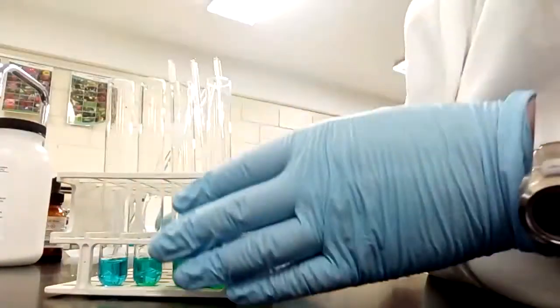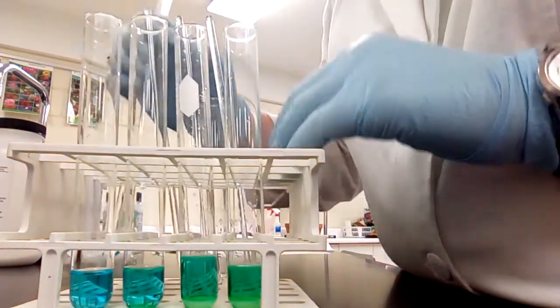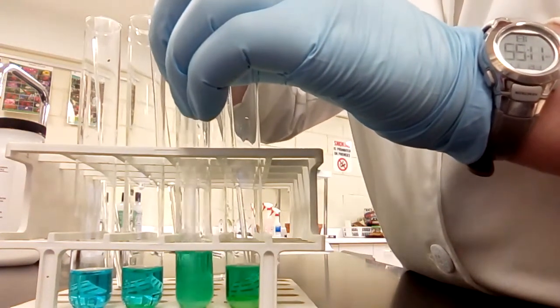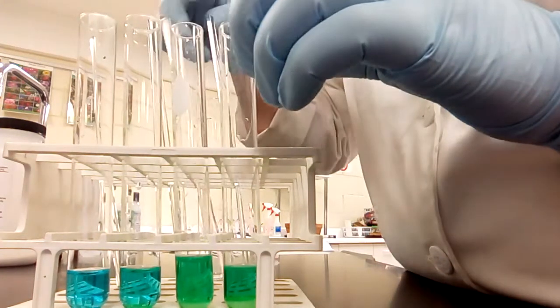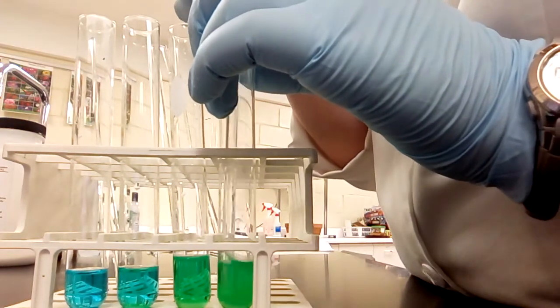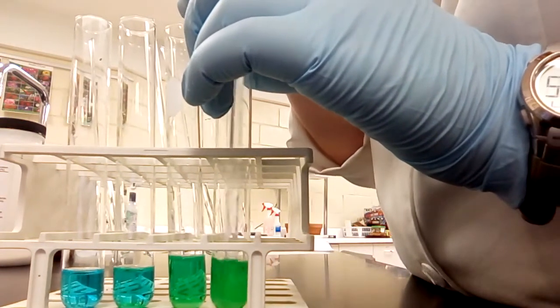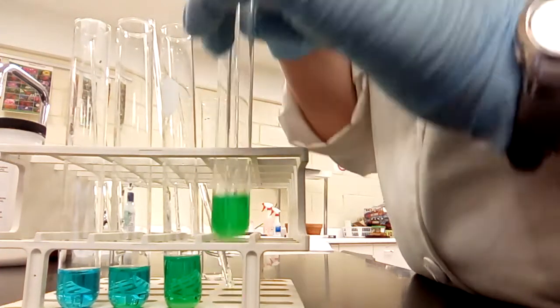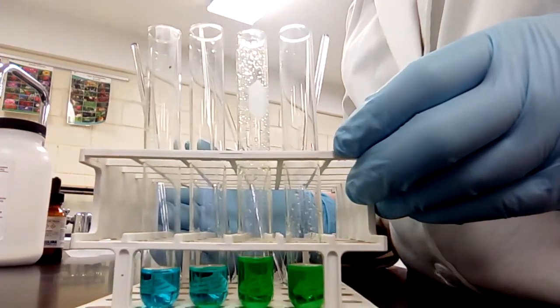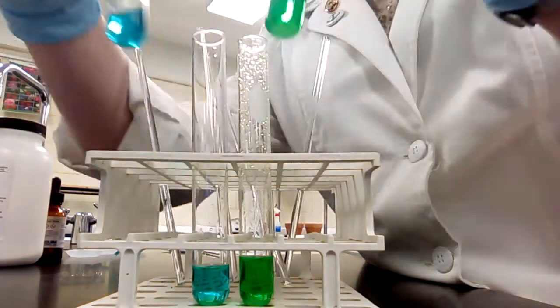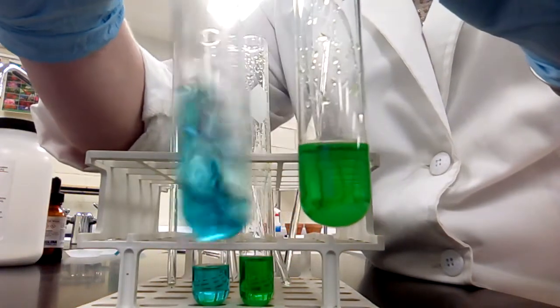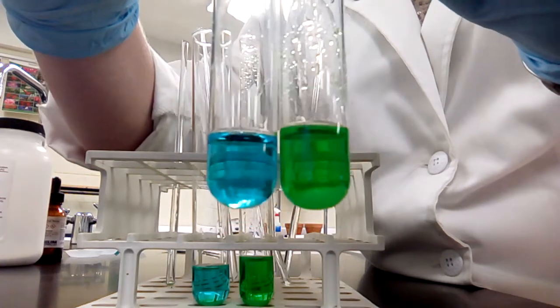All right, there's some other things we can have fun with this. So that's your basic reaction. These need to be a little bit better dissolved. The salt doesn't want to dissolve in there for me. Because, you know, sodium chloride is not the only common ion that we have. There's other things that might shift this reaction and get us to see a pretty good color change here. But still, if we look at our most concentrated one, compared to our control, you can definitely see that color difference.